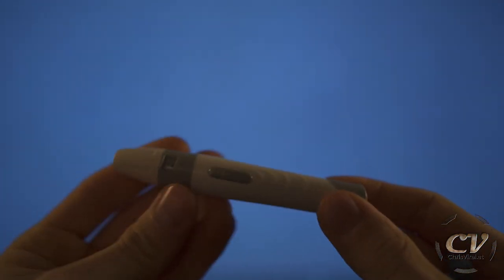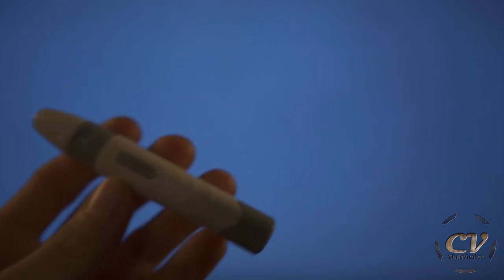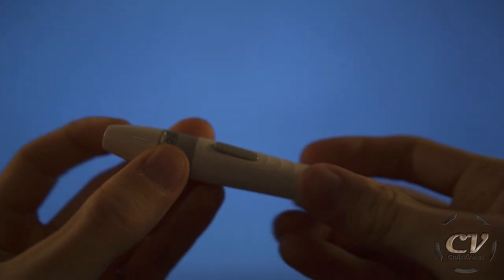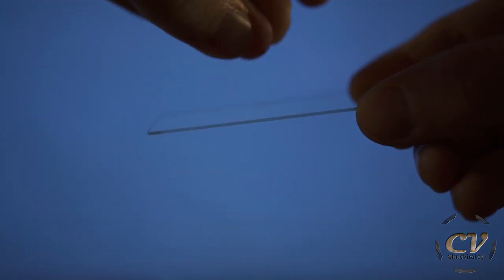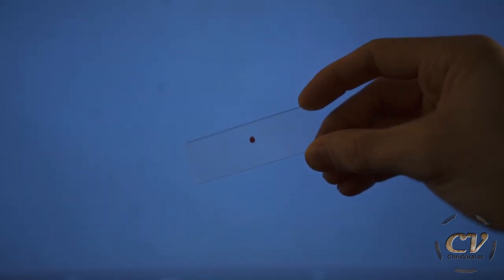I'm ready to pierce my finger with this little pen. Boom, I'm on stage two well-deepness I guess. Let's insert this. Such a tiny needle — I'm scared though. Okay, it's in there. It actually works! It wasn't painful at all. I need to get a nice drop on here. Yeah, I think that should do.